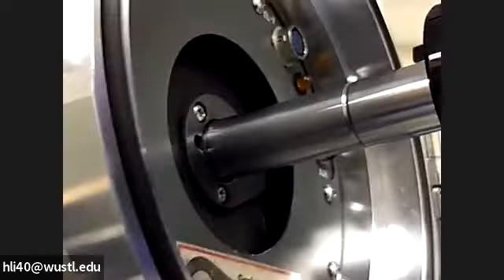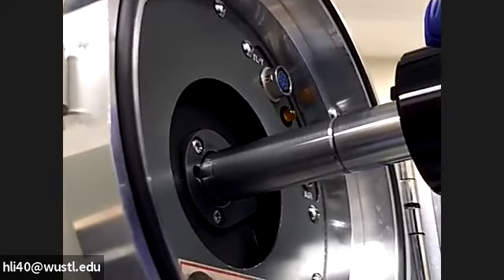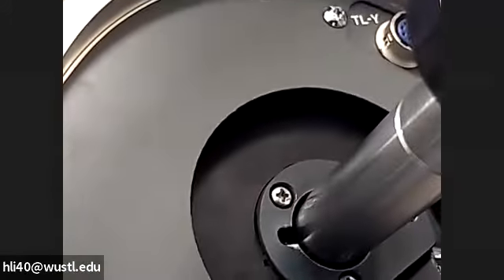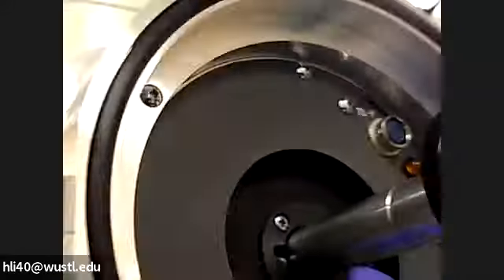Now I'm going to pull the holder out more. If you look at here, I pull. You see it's coming out to about this distance, about three millimeters. After that, you just rotate. So I rotate it already. If you look at inside this hole, the guiding piece should be around this place already. So we just patiently need to wait. We need to change this switch after you pull and stop your holder to this place.